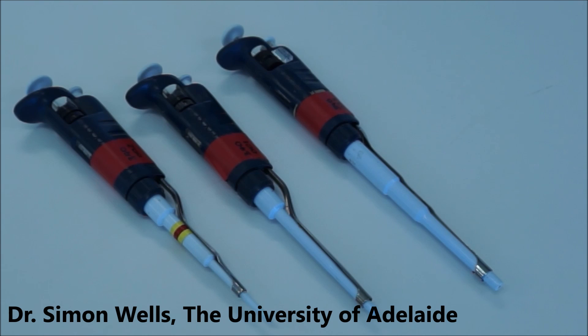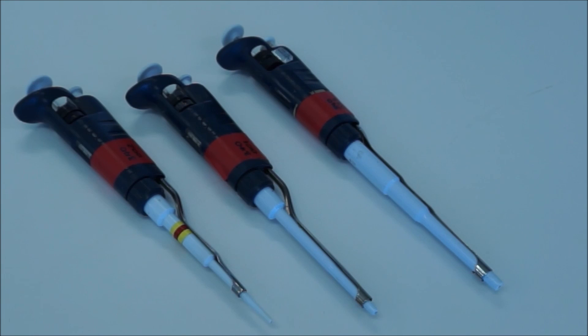For this practical you'll be using a micropipette. Micropipettes are delicate precision instruments for moving about very small volumes in the microliter range.